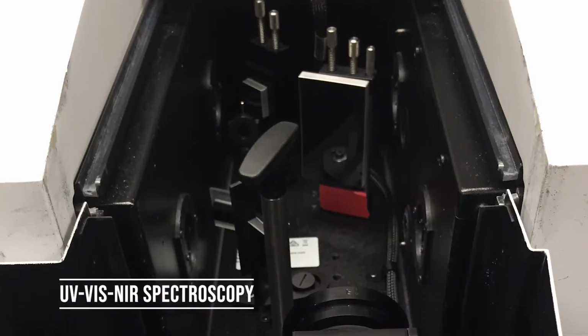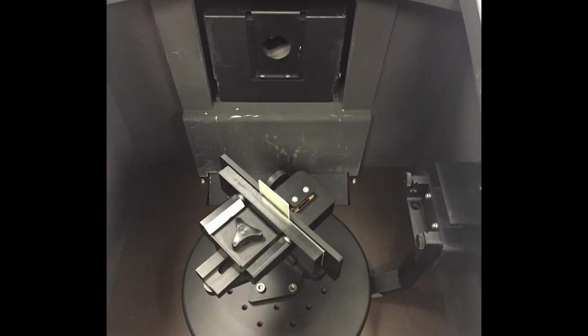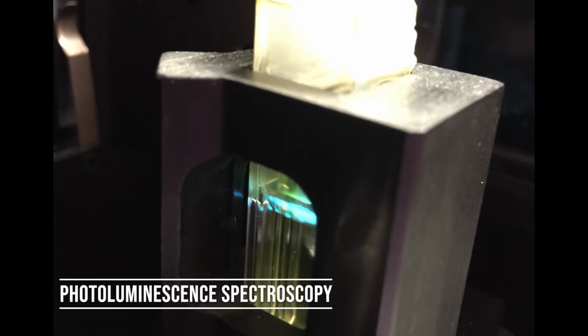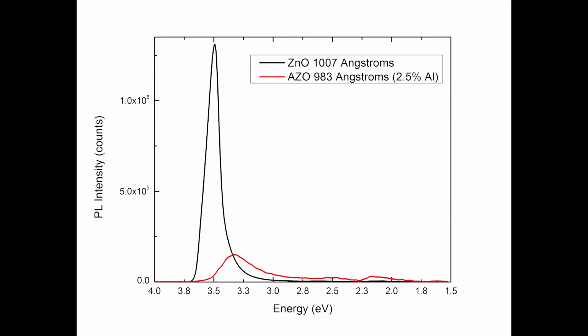The Cary 7000 UV-Vis near-infrared system has an integrating sphere for measurements from 200 to 2500 nanometers. It also allows for variable angle reflection measurements, polarization mapping, and transmission measurements. The spectrofluorometer can be used to make steady-state photoluminescence measurements on liquid or solid samples from 200 to 800 nanometers.